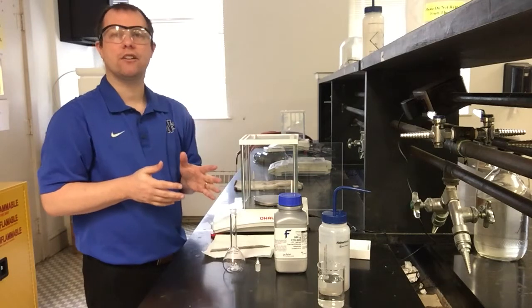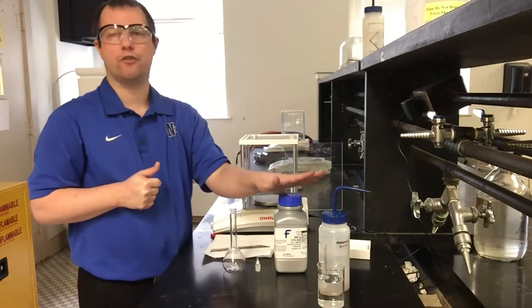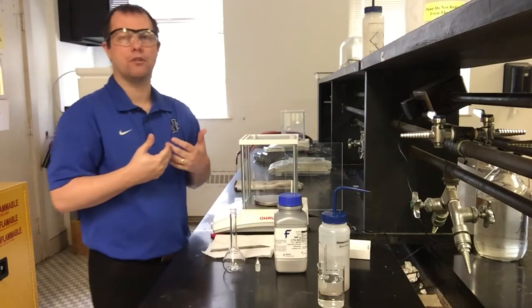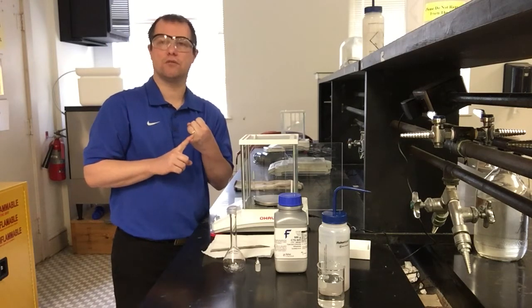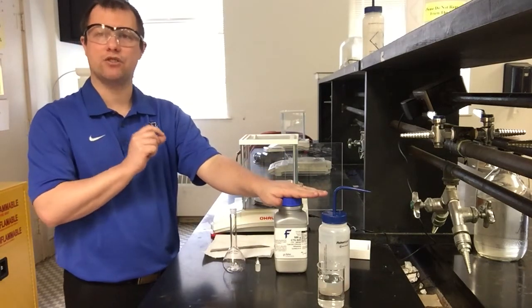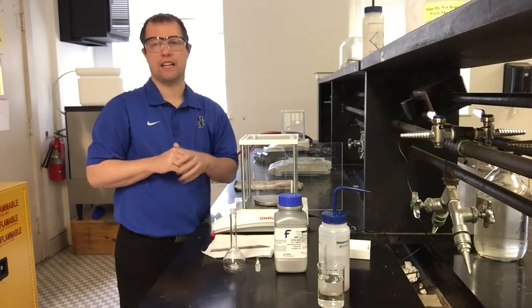Now, making our solutions, I'm going to start, like I said, with the first part, making our solution from a solid. So we have our calcium chloride dihydrate, and if you've gone through your pre-lab assignment, it's walked you through the general steps to figure out how much of this compound we should need to make the proper concentration and volume of our solution. Our goal is to make a 100 milliliter solution that has a concentration of 0.100 molar. And so using this compound's molar mass, and the 2H2O does matter to the molar mass for the dihydrate part of it, we should need about 1.47 grams of that calcium chloride dihydrate.